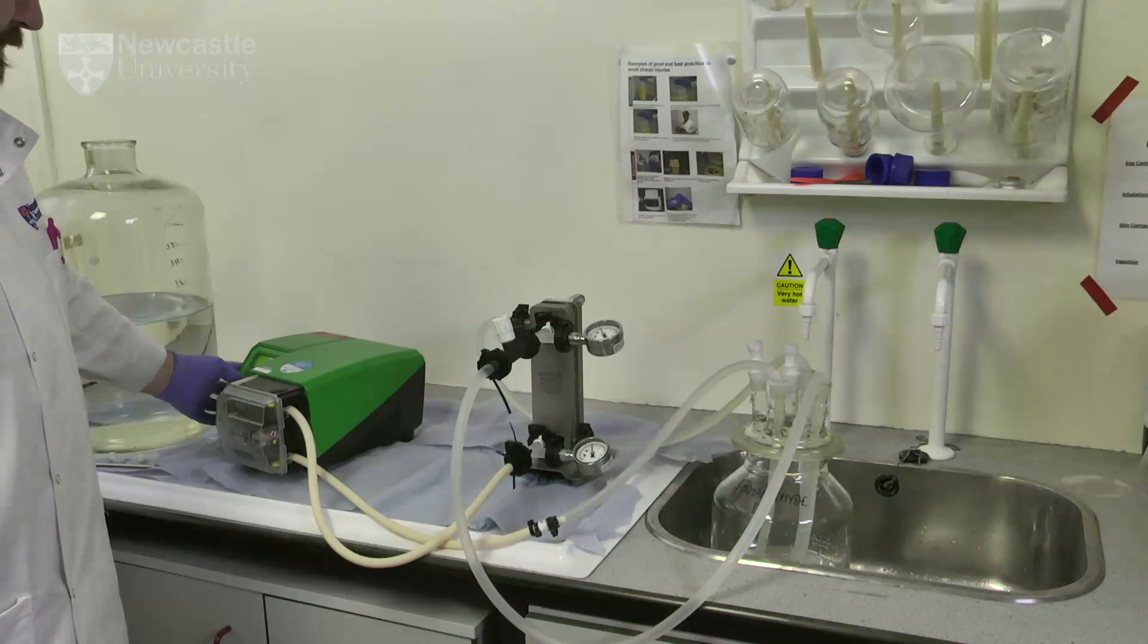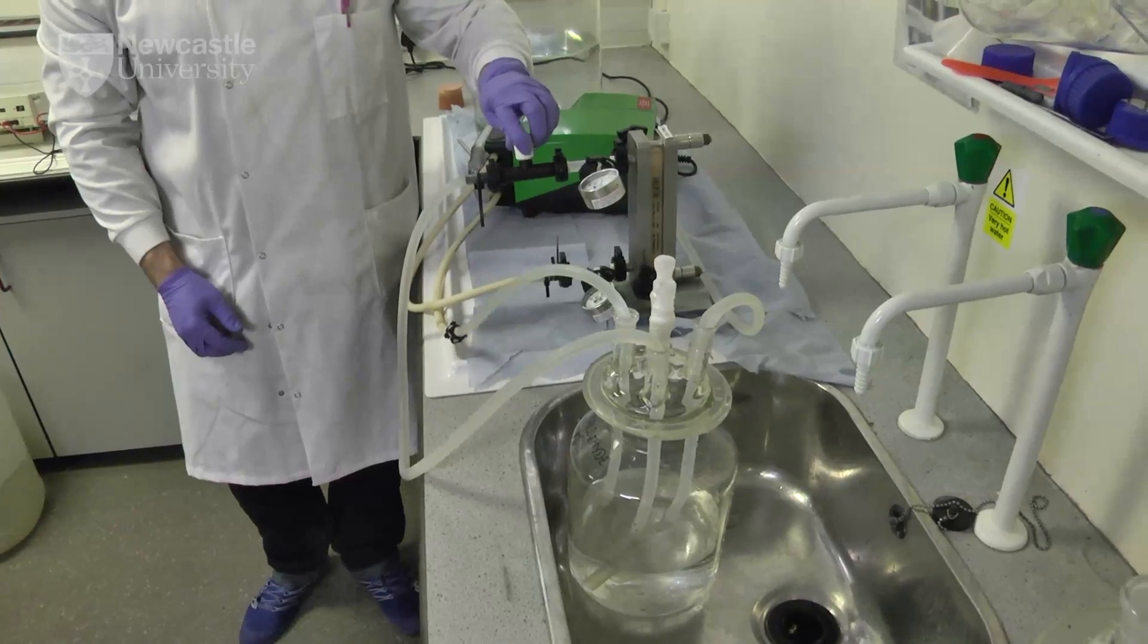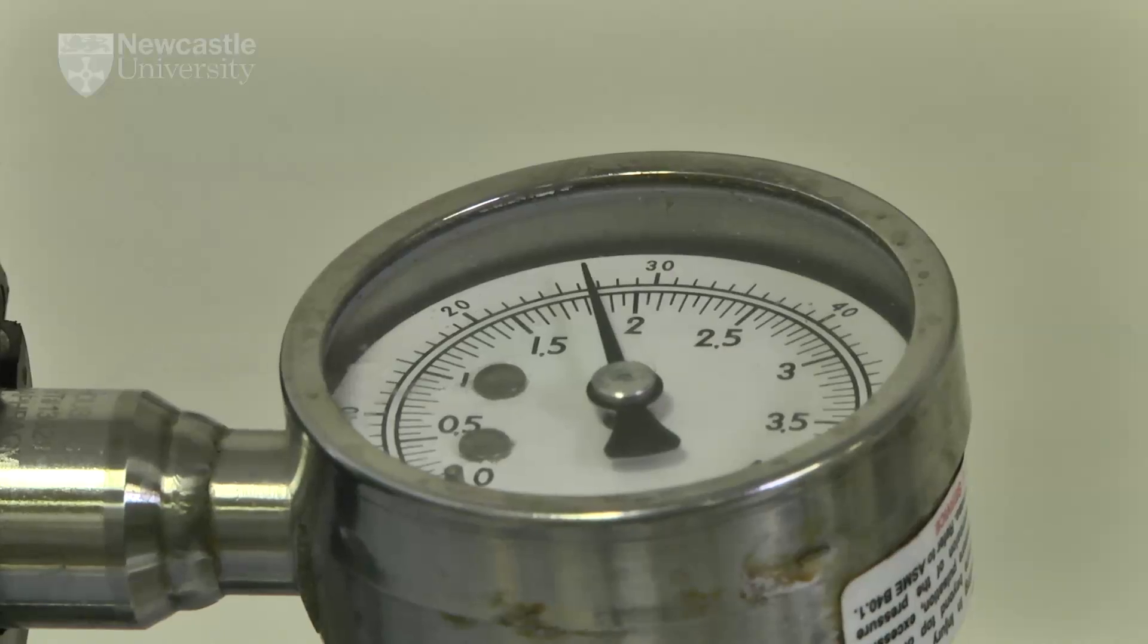The solution, concentration and duration is dependent upon the cassette selected. Fully open and close the retentate valve several times to fully wet internal surfaces.